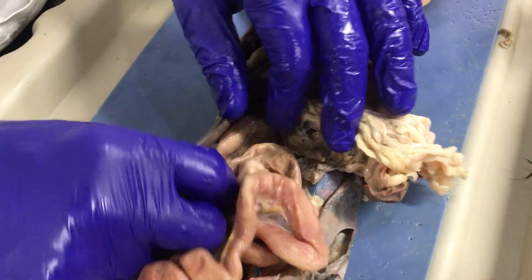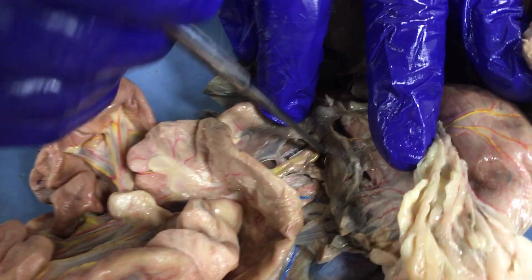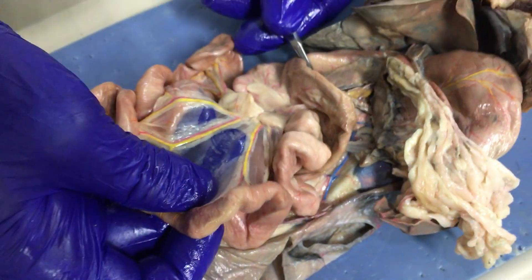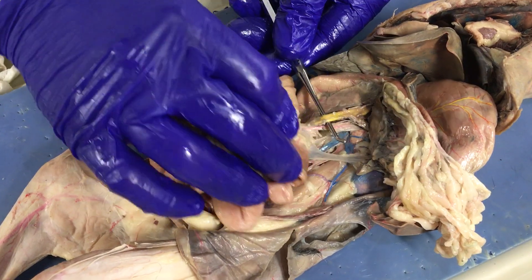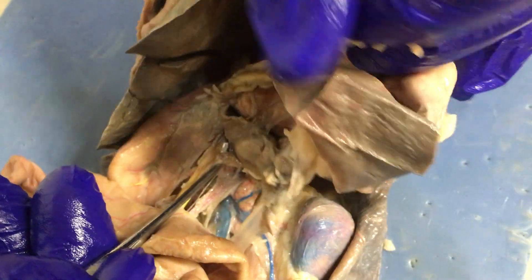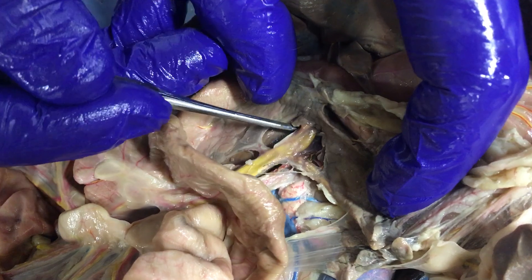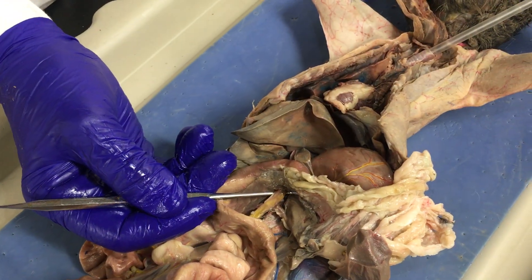If I get the intestines down and the liver up, here are the three major veins that we find. You can see a T intersection here. This is the superior mesenteric vein, which is coming out of all of these small intestine veins right here. The one over here is called the splenic vein, and it's drawing from the spleen over here. Blood is coming away from the organs toward the liver, and so this is the portal vein, which is the one going right into the center of the liver here and distributing blood through the liver.